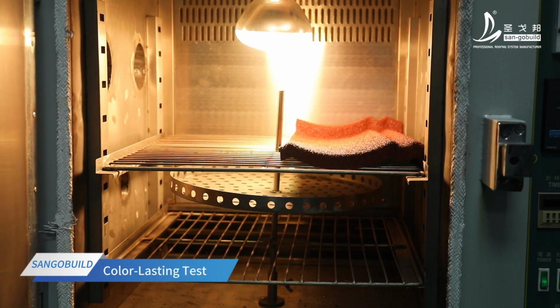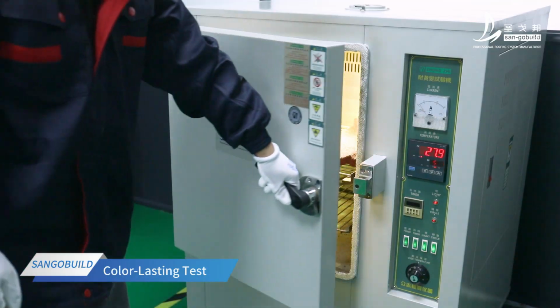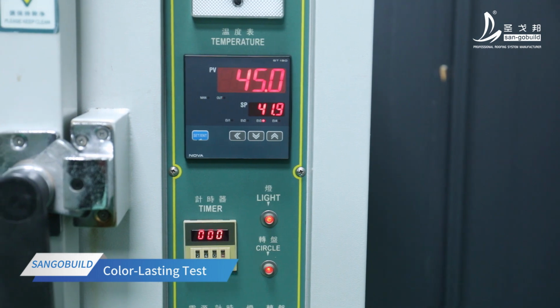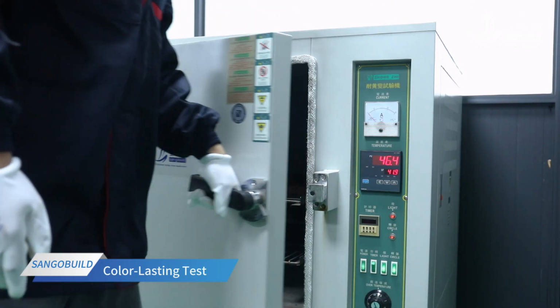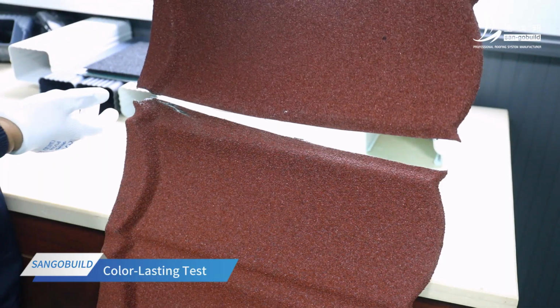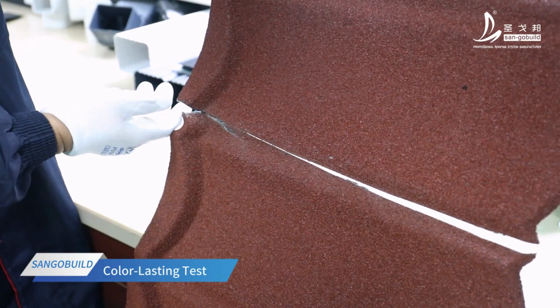After a period of testing, the laboratory technician compares the sample with the original product. The sample is in good condition and free from oxidation without other obvious changes. Pass the test of yellowing resistance.